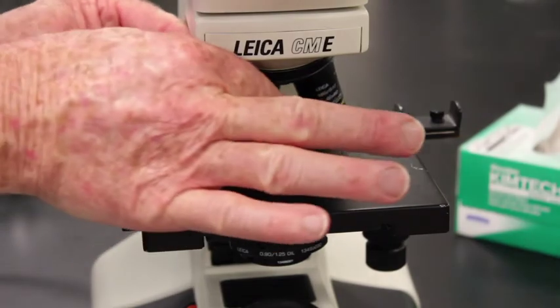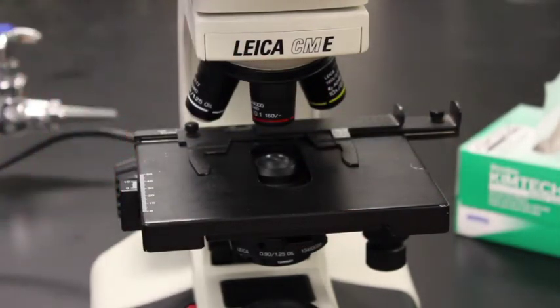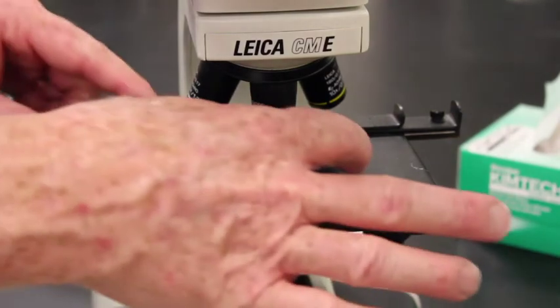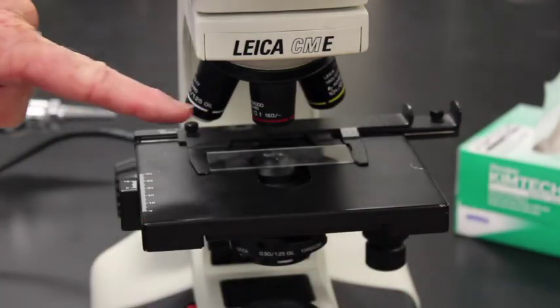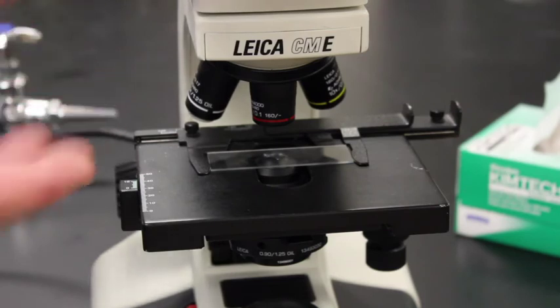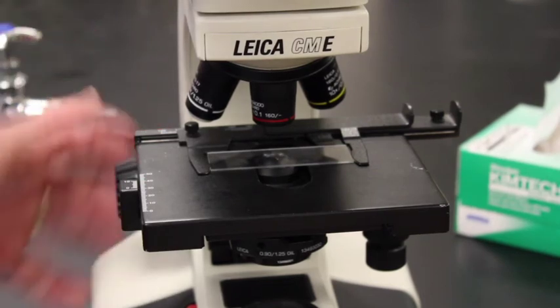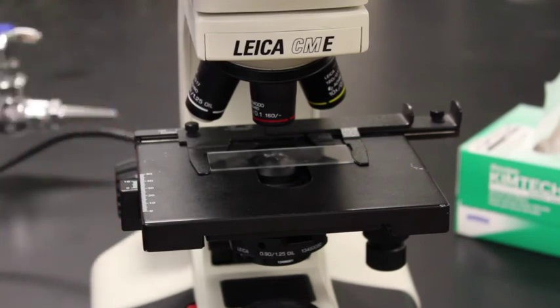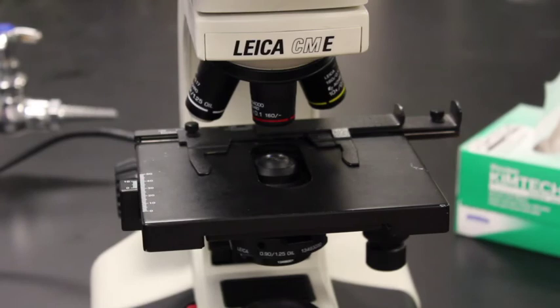Then what I want to do is wheel in the 4x. Do not change the focus, because the next student comes in, and if that student just puts their slide on the stage right there, it will now be in focus. I don't have to crank this up, crank this down. It's in focus. The next student is in focus. If everybody does that, we don't have a problem focusing, because one of the biggest time sinks in here is focus, and the big problem is that students crank this up and crank this down. Put in the 4x, remove the slide, and you are set.